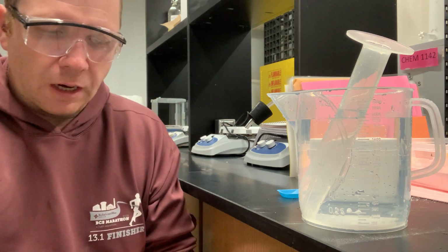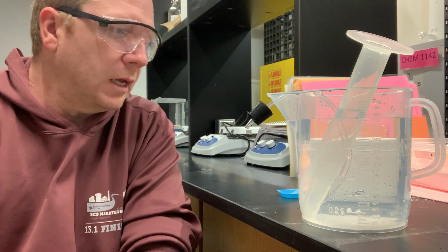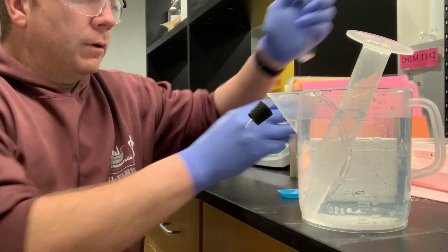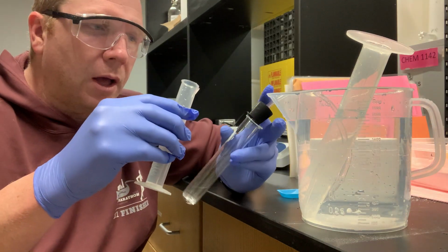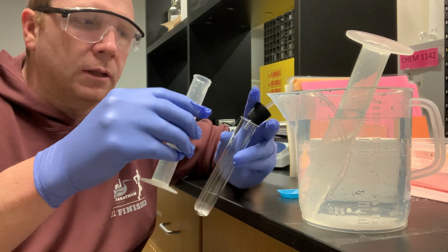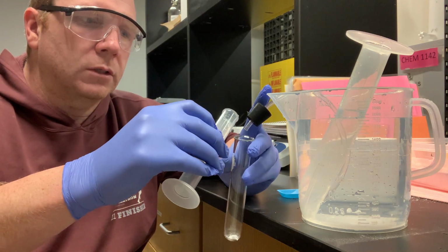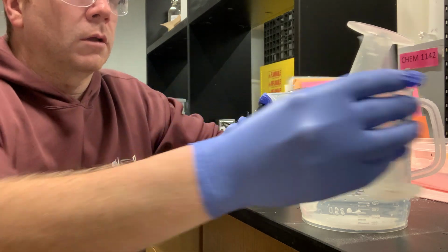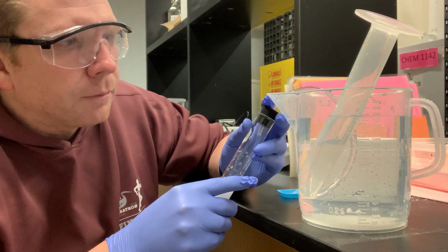You want to be careful when doing this and not work too quickly that you make any mistakes or make any sort of messes. So I've got my hand positioned so that I can put the cap onto my test tube immediately after transferring my 10 mil of HCl into this test tube. So I'm gonna pour, and there we go. As you can see, the gas has bubbled up.